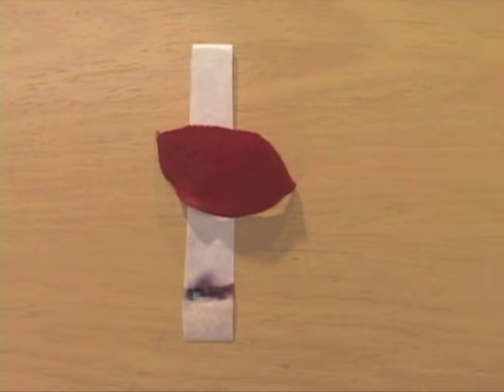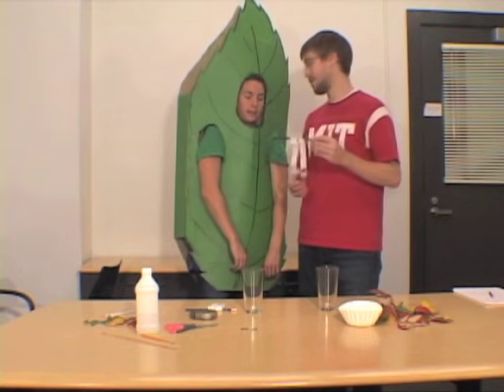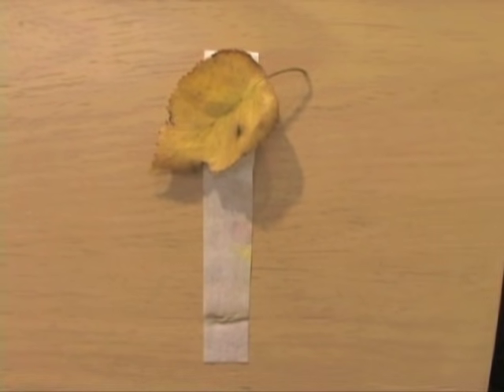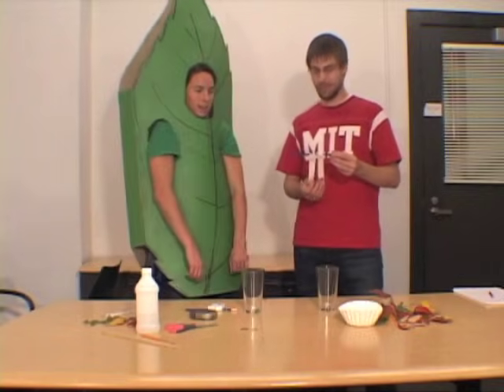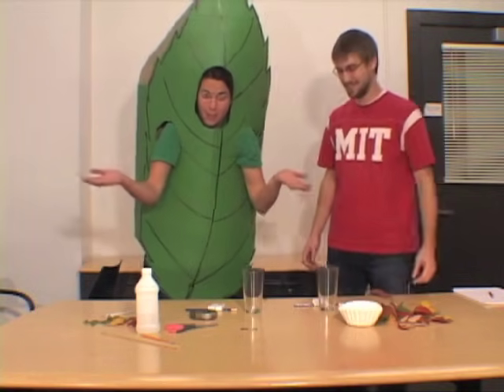The strip from the fully red leaf shows a lot of vibrant, dark red with very little else — because the leaf has already turned and the chlorophyll has been lost. On the yellow leaf strip, there's a strong band of yellow xanthophyll, but right underneath it there's still a band of green chlorophyll. And above the yellow, there's even a little bit of red, showing that every leaf contains multiple pigments regardless of the color it appears.